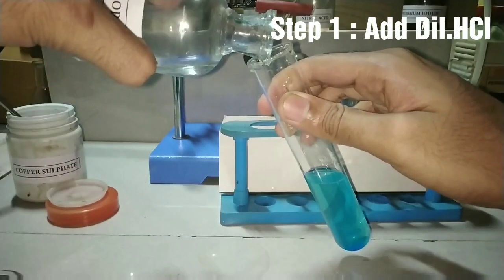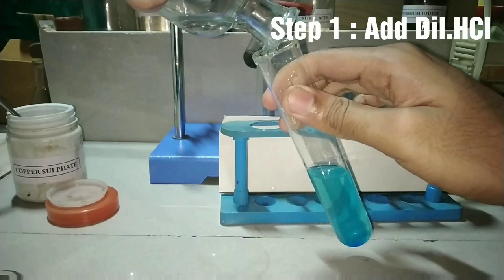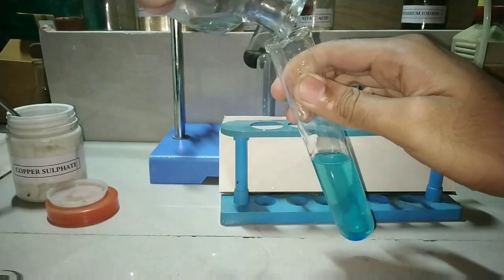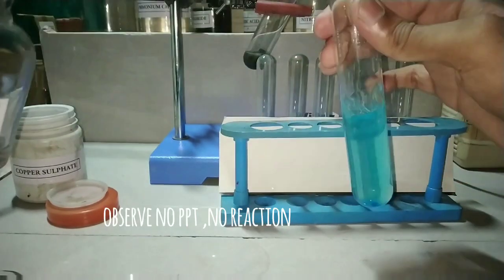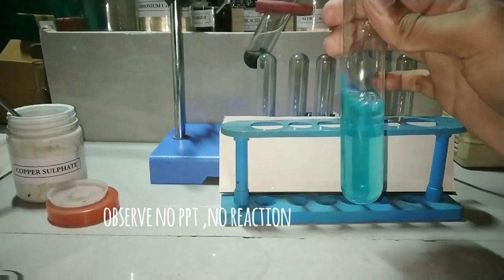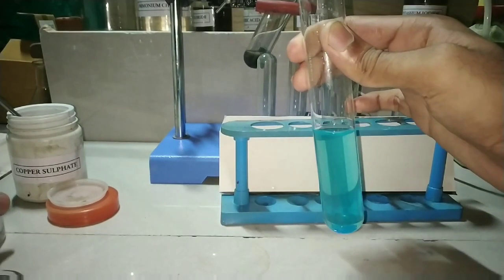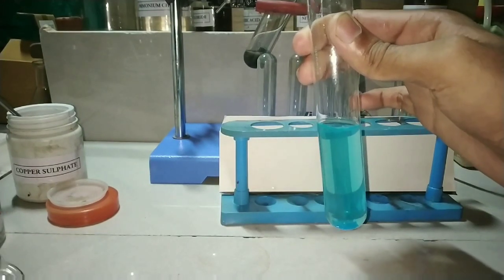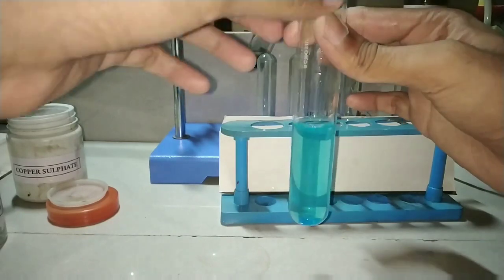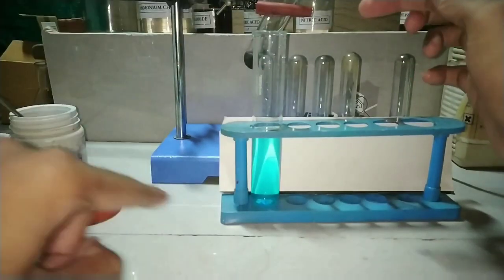The next step is to add the hydrochloric acid. We would have already added the hydrochloric acid as part of the group analysis for group 1, and since that is negative here, we don't have any precipitate or any reaction that has occurred.